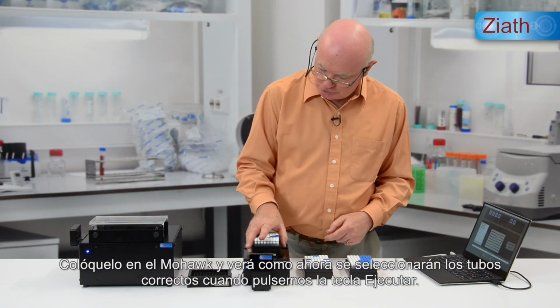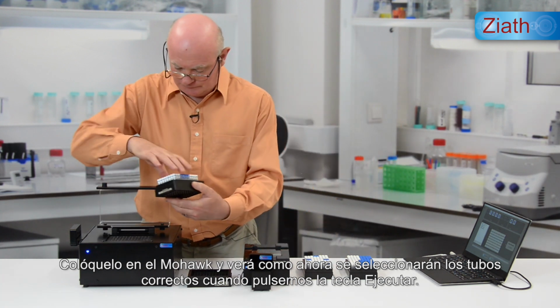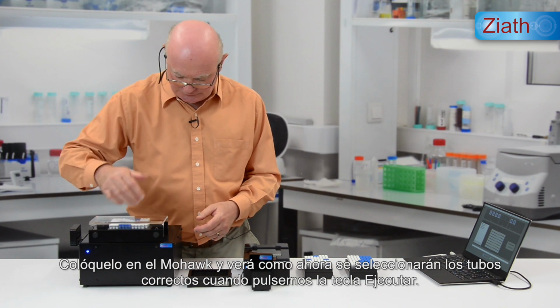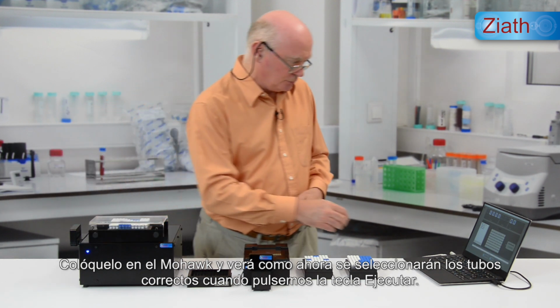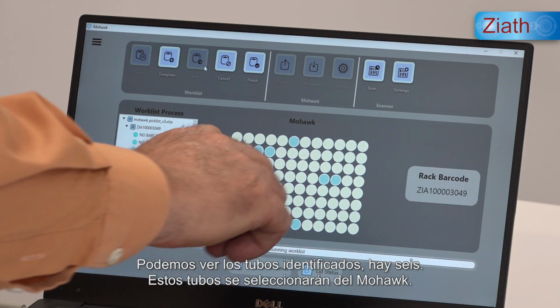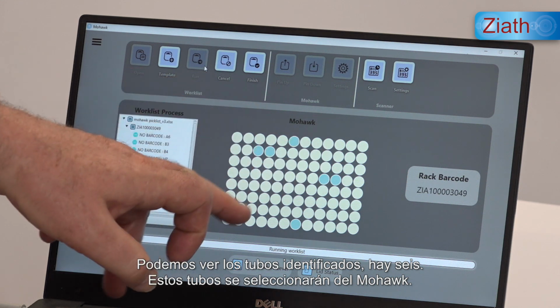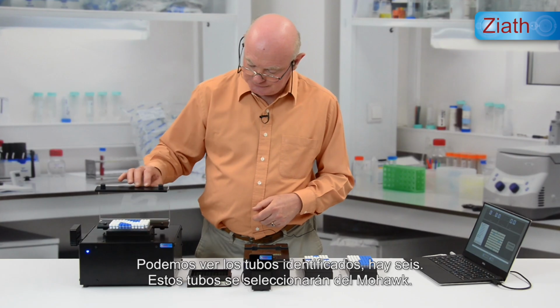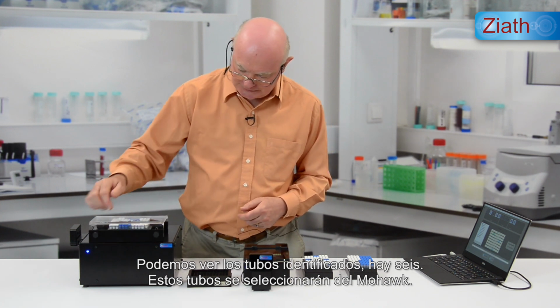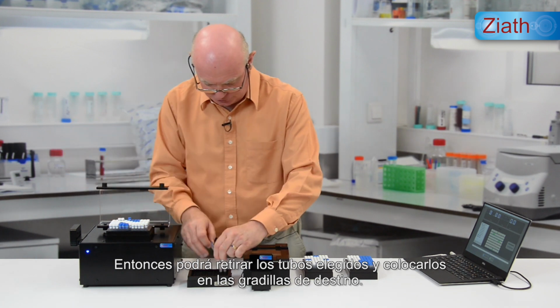If we then place it onto the Mohawk, the correct tubes are now picked when we hit the run key here. So here we can see the identified tubes. We've got 1, 2, 3, 4, 5, 6 of them, and those tubes will then be picked from the Mohawk like that. The picked tubes can then be removed and put into the destination racks.